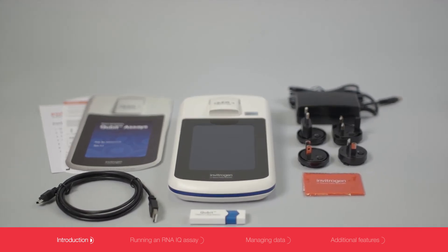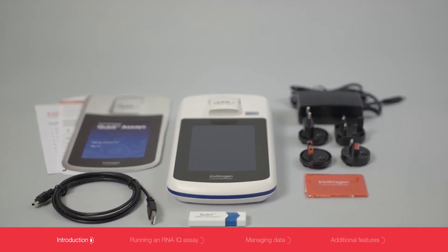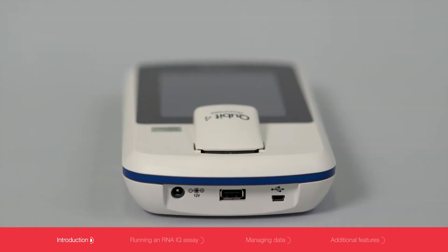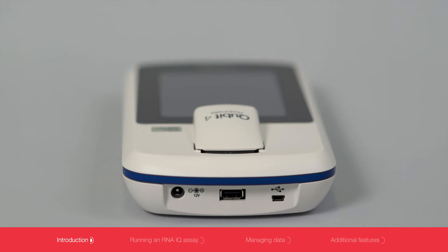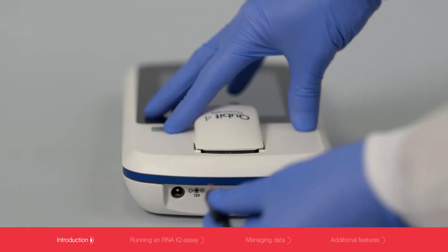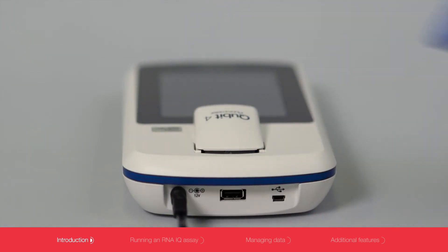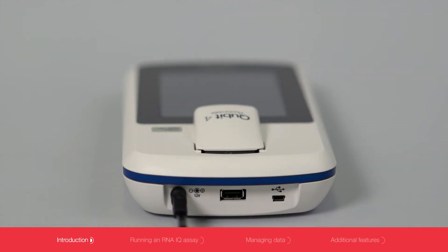The Qubit 4 fluorometer is simple and easy to use. It's designed so that you can quantitate or qualify your sample right out of the box.